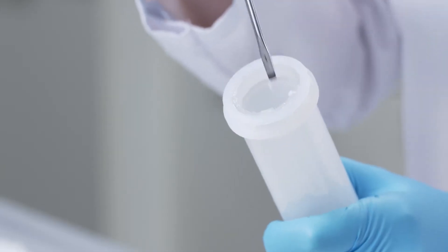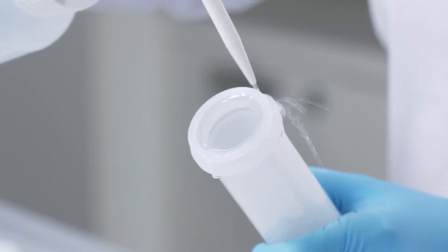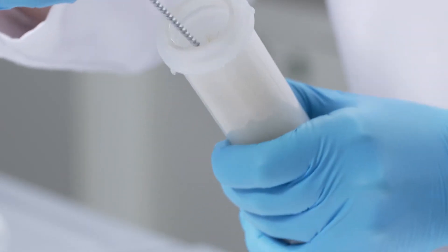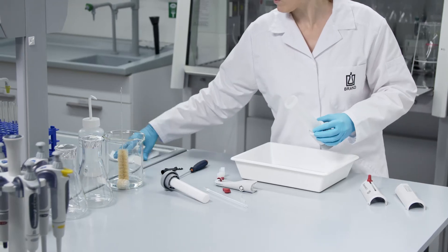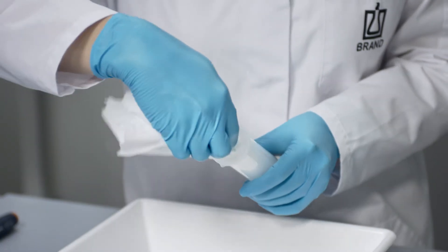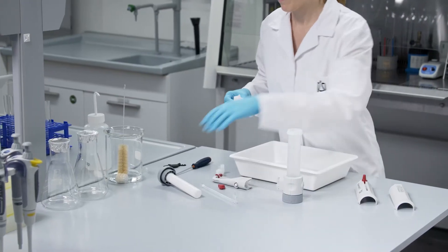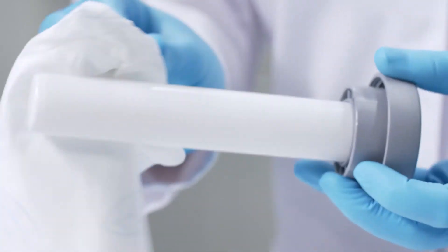Carefully remove deposits at the edge of the glass cylinder and rinse the piston and cylinder with deionized water. Then clean the cylinder with a bottle brush and a suitable cleaning solution. Wipe the cylinder and piston with a damp cloth. Piston and cylinder must be dry before assembly.